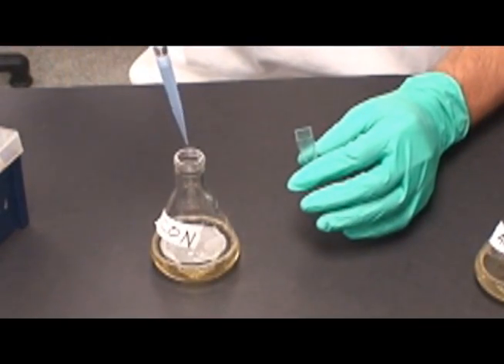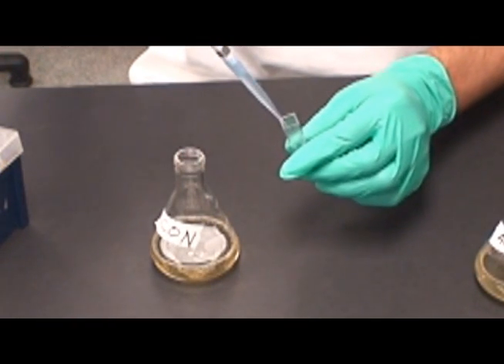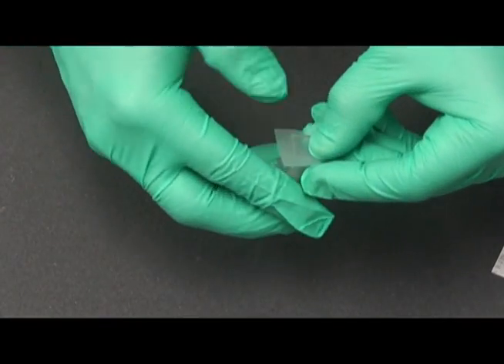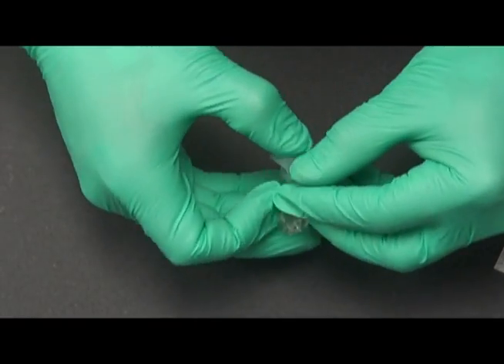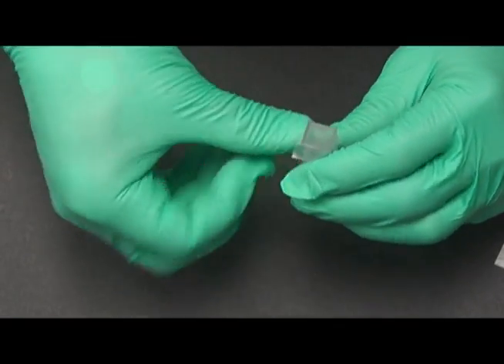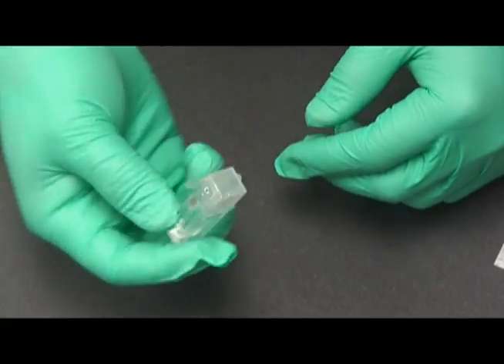Make sure to practice sterile technique during all transfers. Covering a cuvette with parafilm ensures that spilling will not occur. This is shown here and should be done to every cuvette used. The parafilm can be easily stretched around the edges of the cuvette to make a tight seal.